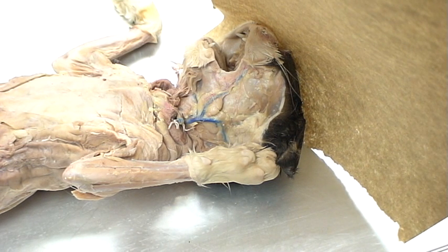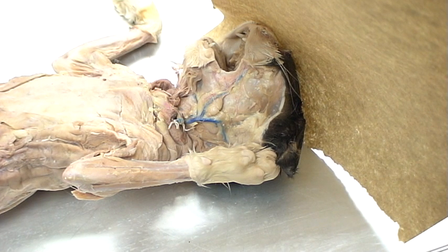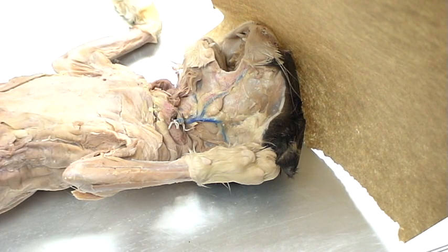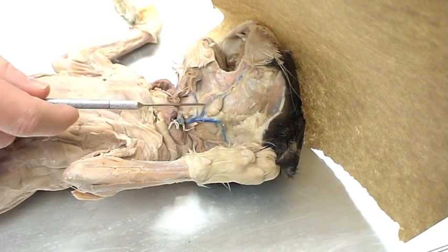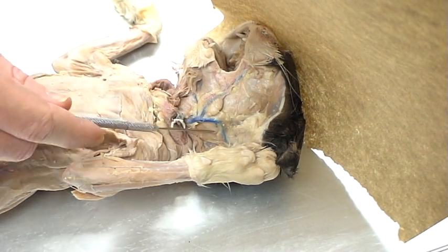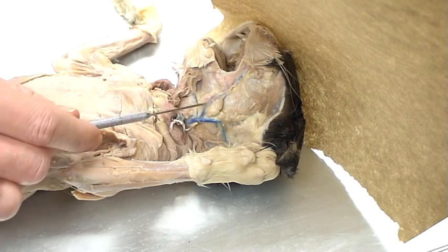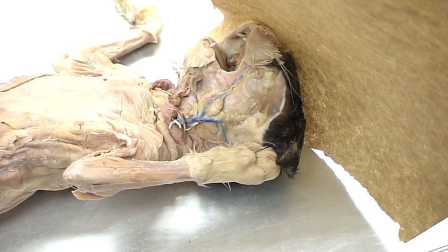We're going to start today with a dissection of the salivary glands and ultimately the whole digestive system, but today we're just starting with the salivary glands themselves. I've got an exposed section of the skin around the face so we can see into the cheek itself. One thing to look for is the blood vessels going up — we'll name those when we take a look at the circulatory system. These three fingers coming out will be our landmark so we can see these glands.